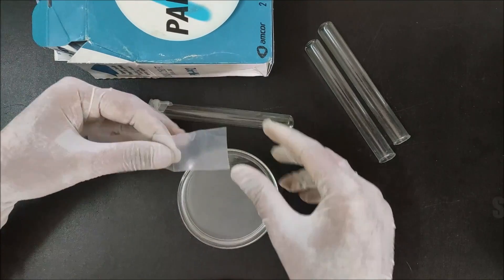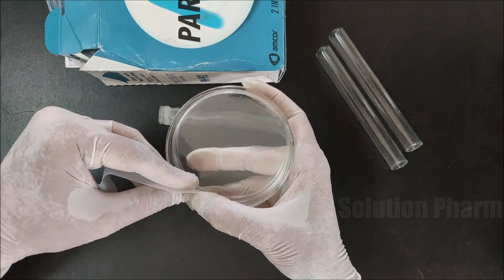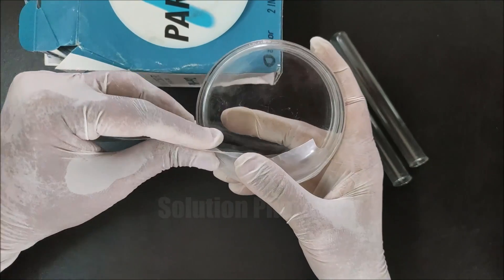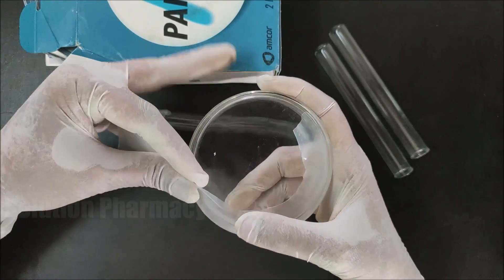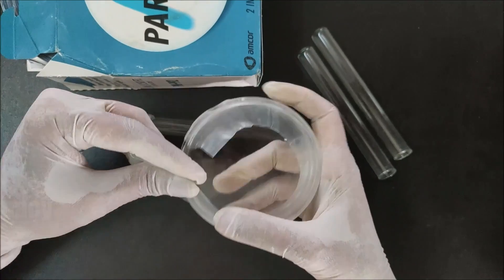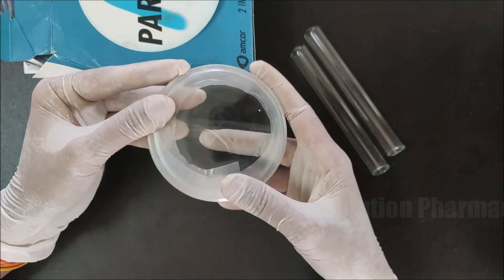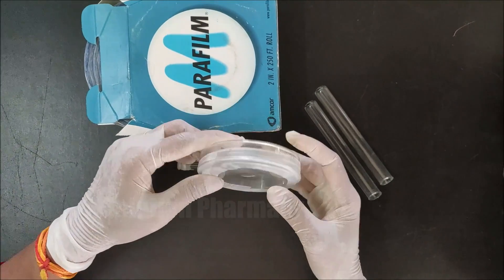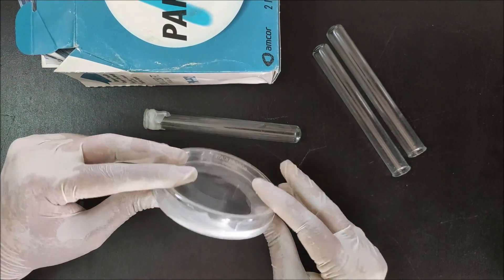Wrap the film around the edges of the petri dish to seal it. Hold one side of the strip, press your finger on the edges of the petri dish, then stretch it to seal the edges. Stretch the parafilm at every point and go around to completely seal the circular edges of the petri dish. Press the parafilm at the end. The petri dish is now completely sealed. By sealing the petri dish containing media, we can store it for a long time to prevent contamination and entry of moisture. Thank you very much for watching this video.